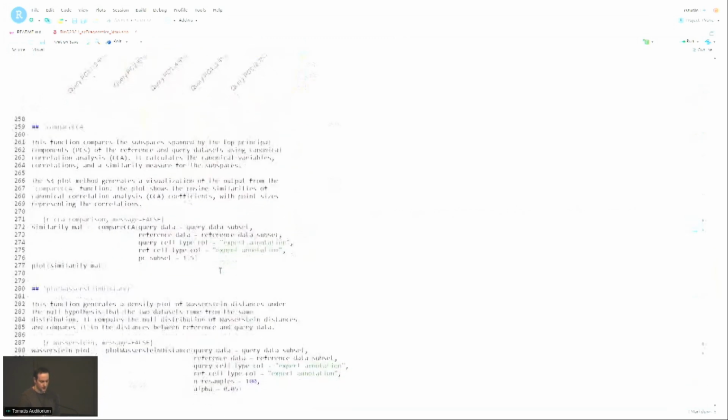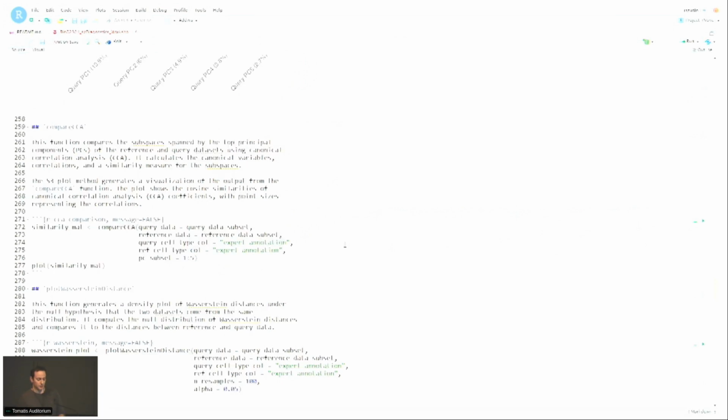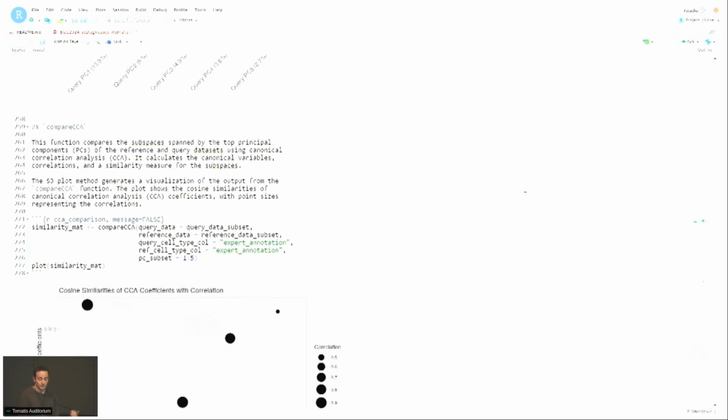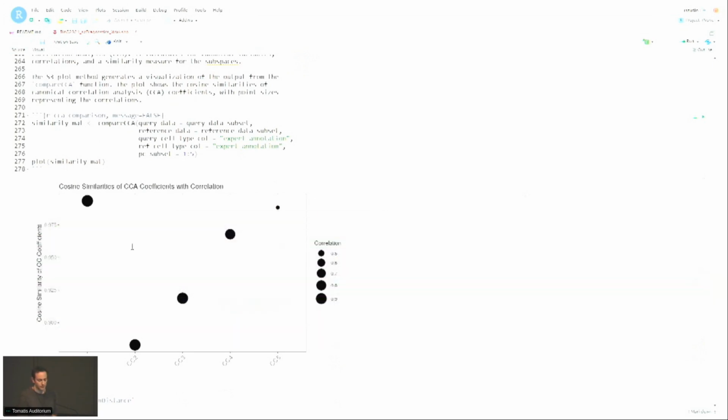Okay. There's also canonical correlation, which obviously is very relevant for this type of exercise where you want to compare how the reference and the query align. So in canonical correlation, we're looking for separate directions in each data set that align well with each other. And obviously, if things align well, you would imagine that each of these vectors have a high cosine similarity and have a high correlation with each other.